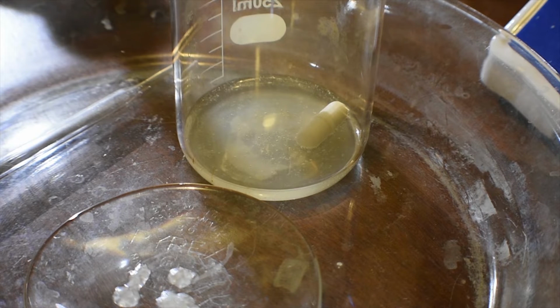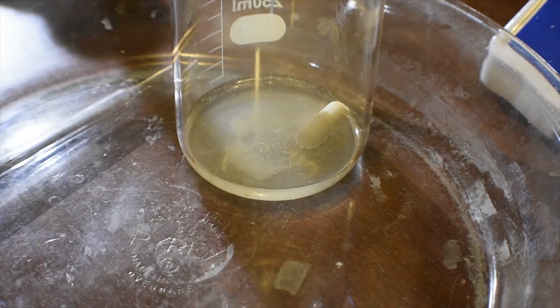That will precipitate out the hydrate of the rhodizonic acid, and you can isolate it from there. But since we're trying to get different rhodizonates, we're just going to continue on. So what you're going to need here is some distilled water. Actually, let me go back to the hot plate.